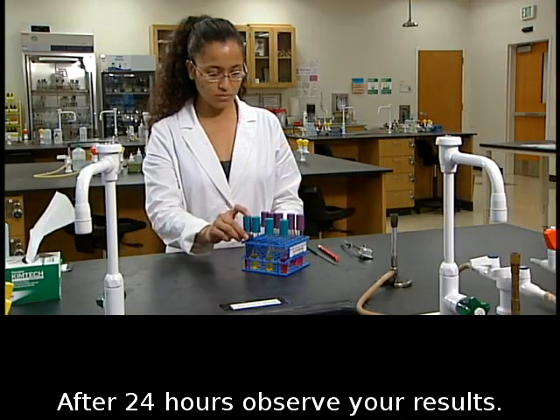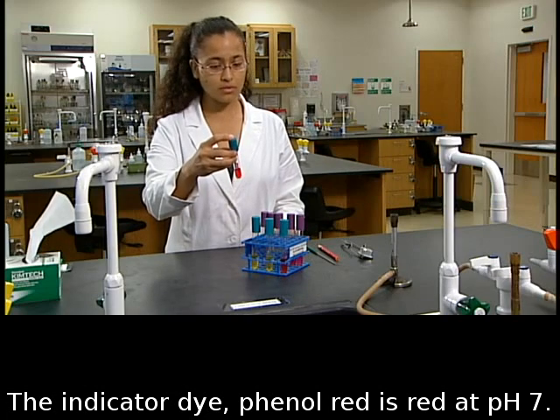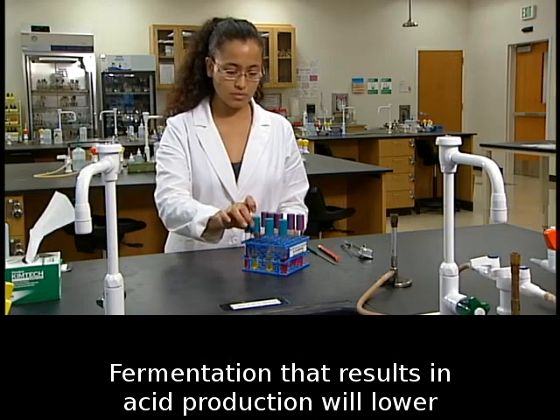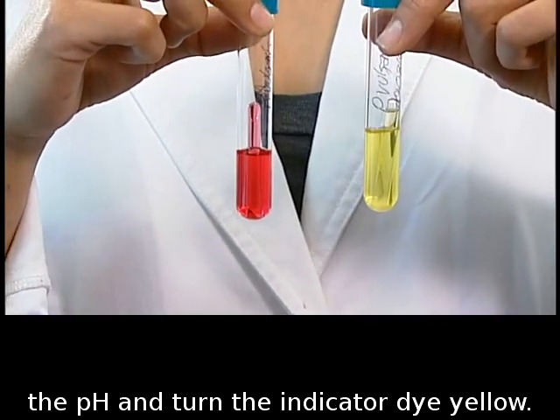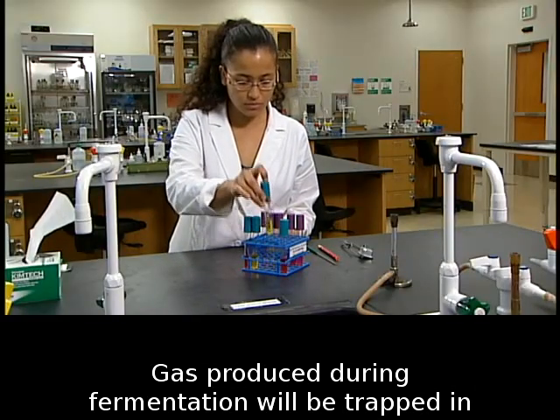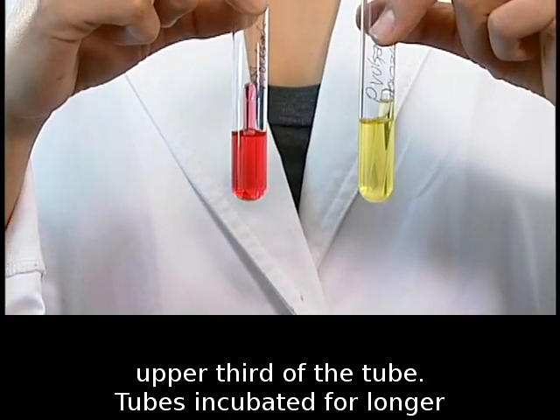After 24 hours, observe your results. The indicator dye, phenol red, is red at pH 7. Fermentation that results in acid production will lower the pH and turn the indicator dye yellow. Gas produced during fermentation will be trapped in the Durham tube and will appear as a bubble in the upper third of the tube.